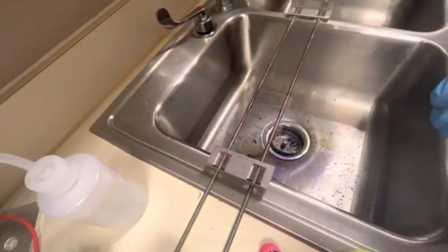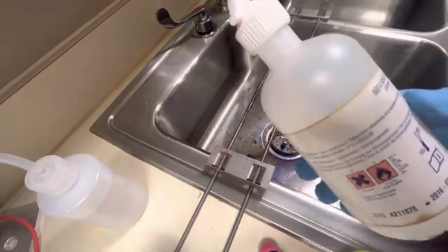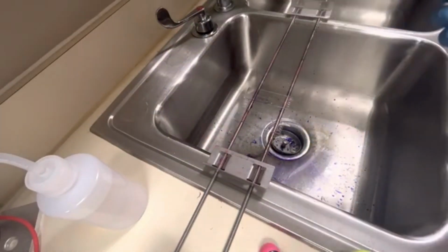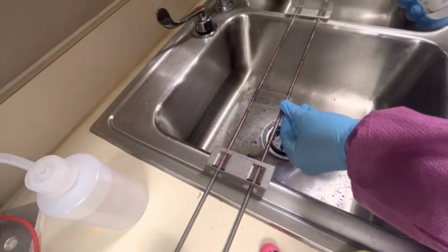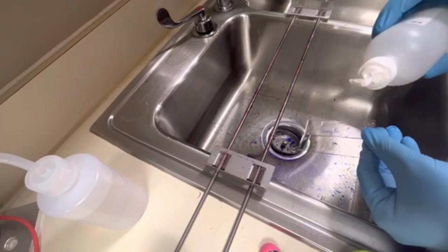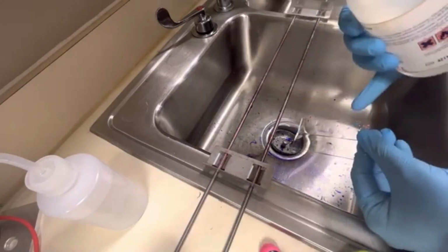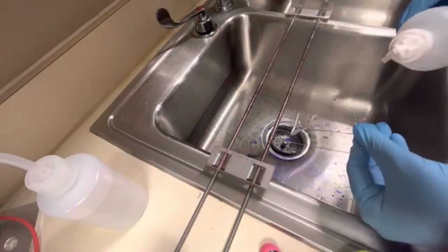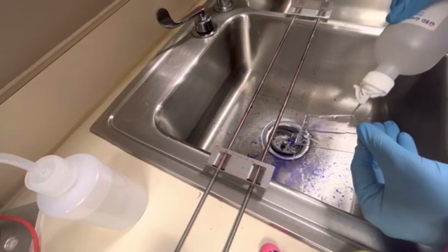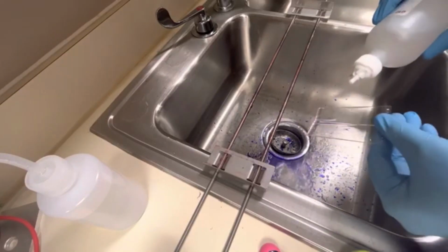All right, so this is what's going to remove the crystal violet stain from the thin walls of the peptidoglycan layer on gram-negative bacteria. What I like to do with these is set them at a 45-degree angle, and I'm just going to rinse them with this decolorizer until the crystal violet comes off of it. You'll see what I'm saying. Okay, you see how there's crystal violet coming off of the slide? All right. That should do me. Okay.